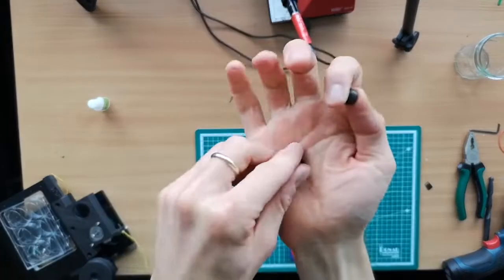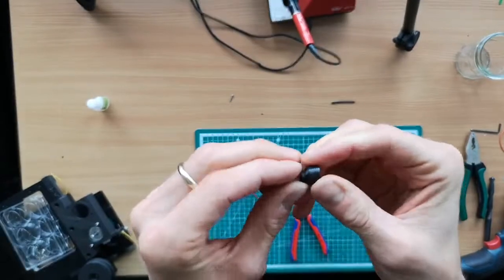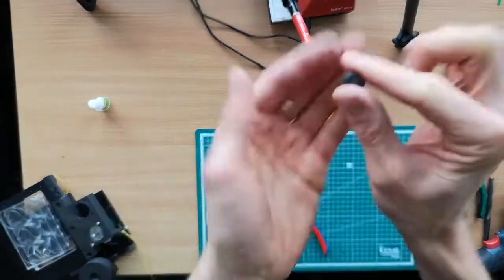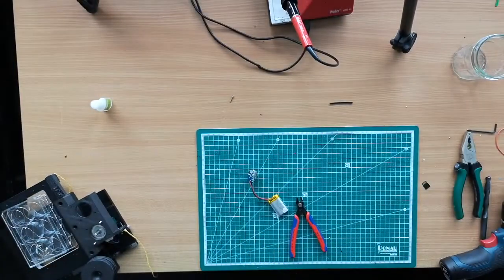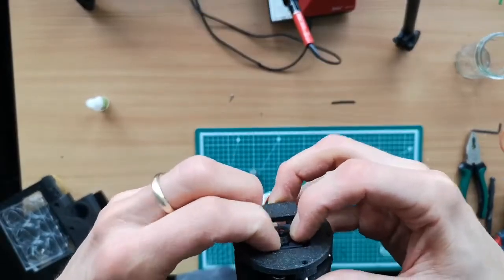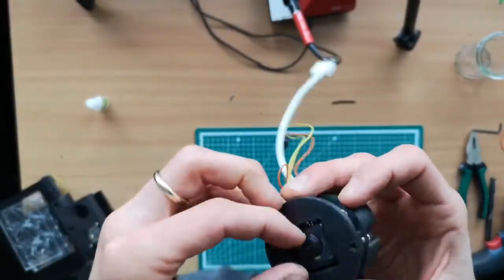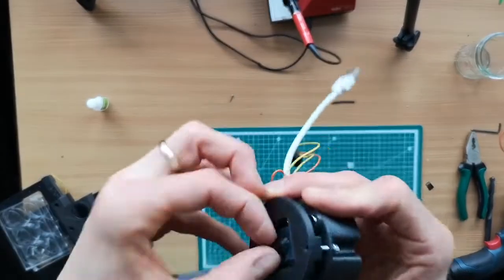So now we have to insert the lens into the barrel that is mounting it to the M12 lens assembly. We have to push it inside the plastic so that it becomes parallel to the ground here. And then once this is done, we can press fit it in here, and then we are done. So make sure that's tightly mounted. You can also add some glue, and then you see that this moves up and down, and then you're done. Make sure the lens is parallel to the stage, like almost so.